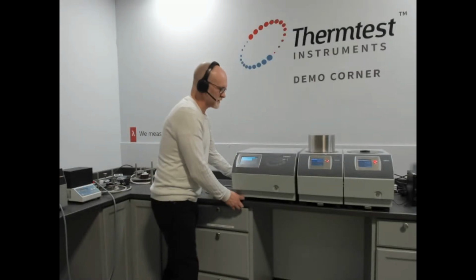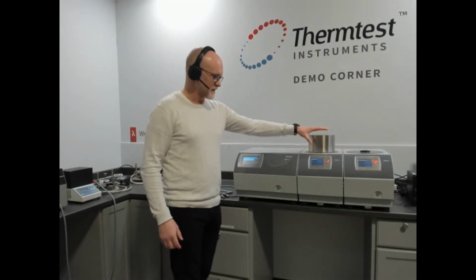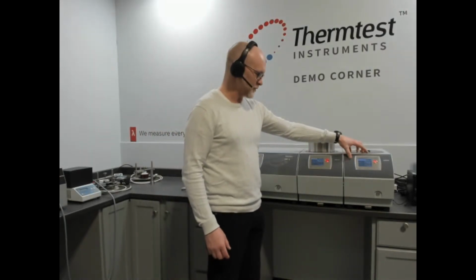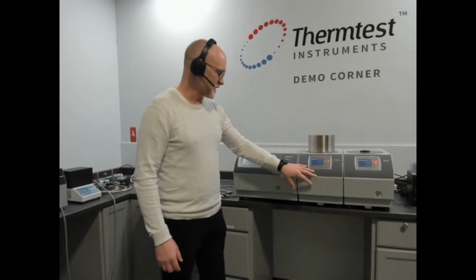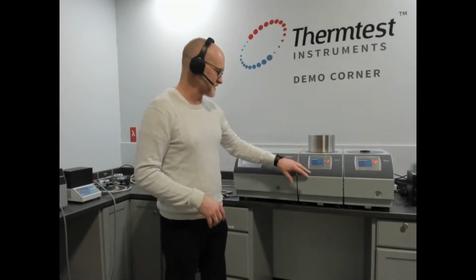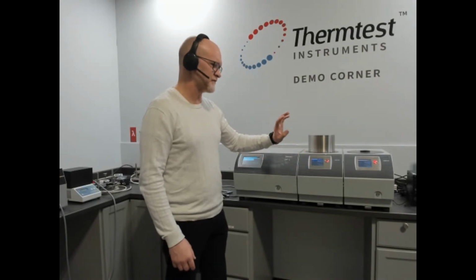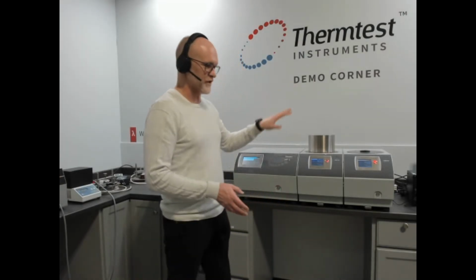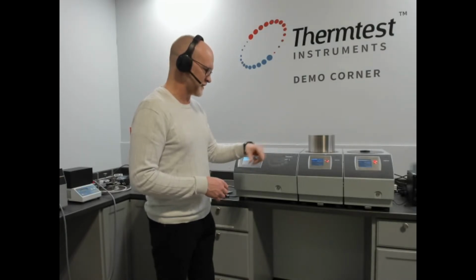But you can also join with it our temperature platforms. This is a transient plane source temperature platform. This is a transient hot wire temperature platform. These both, based off of the temperature range you require, have ranges of minus 160, minus 45, 0 to 200 and 300 Celsius. So the overall full temperature range of these are 300 Celsius all the way down to cryogenic if you need it configured that way.